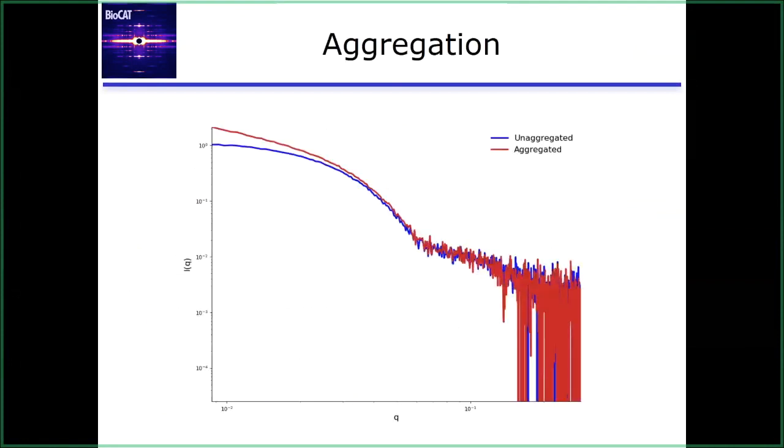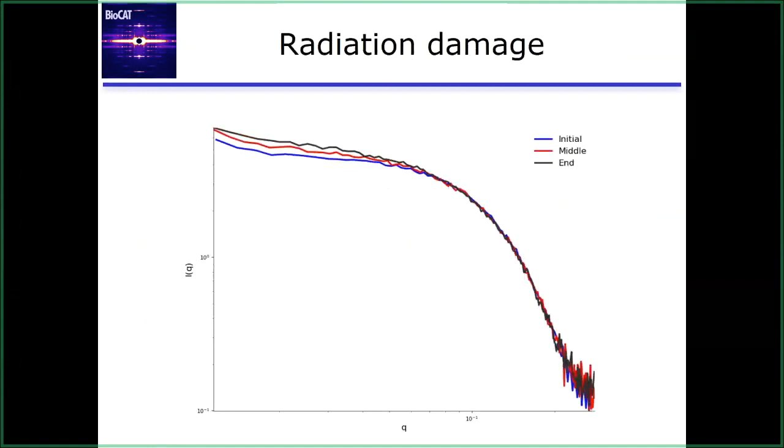So what do these look like in a profile? Well, aggregation is kind of the most common thing you'll see through various effects. And generally speaking, what that looks like is an uptick at low Q. So again, these are generating larger size things in solution, or you start with larger size things in solution. They're going to scatter at low Q, right? Because that's where big stuff comes in. You can see here we have a profile with the unaggregated system in blue, and then when you have aggregate in it, it goes up into this red one. There's this big uptick at low Q, and it looks actually pretty terrible. This is an extreme case. You can have smaller amounts of aggregation. I'll show something like that later. Radiation damage typically manifests as aggregation in your system.